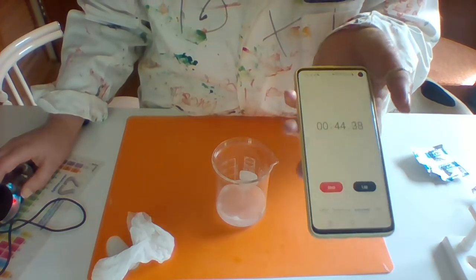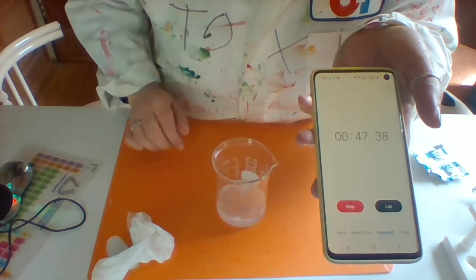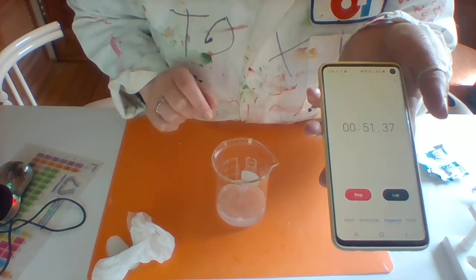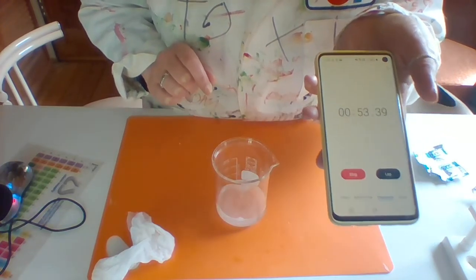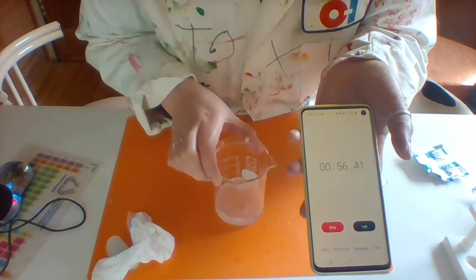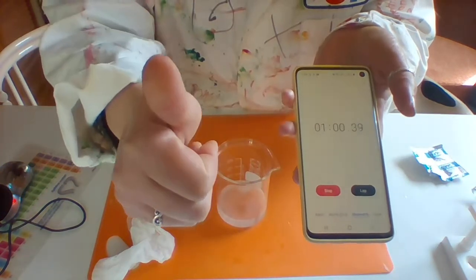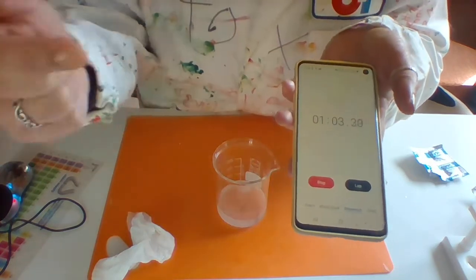Nearly done. There's a tiny little bit left. Done — check the time.